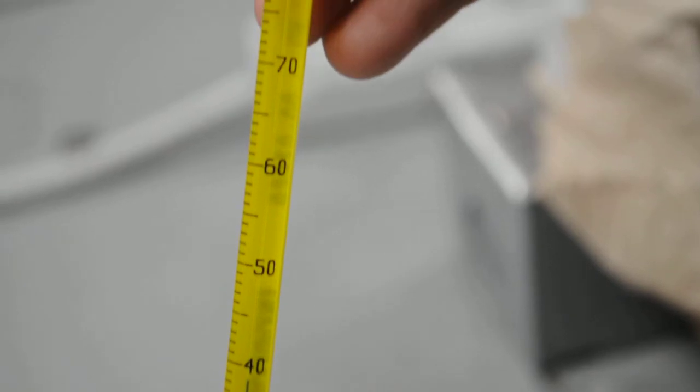Now what do we have? Are we going down? Yeah. Okay. Oh, the paper's hot. Okay, we're coming down. Yeah. Where's the top of that? At 50 I think. No. 50? No, it's on 30.